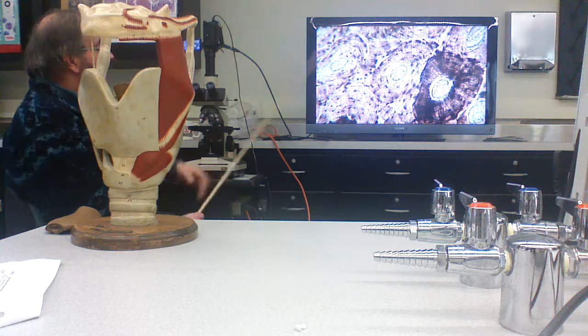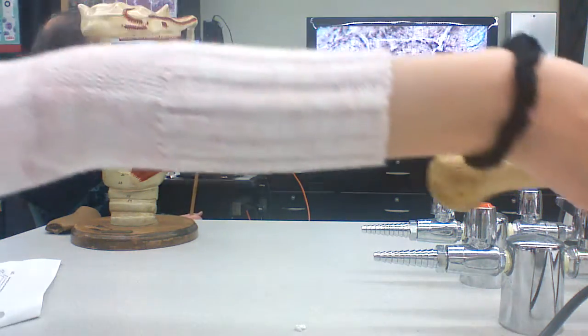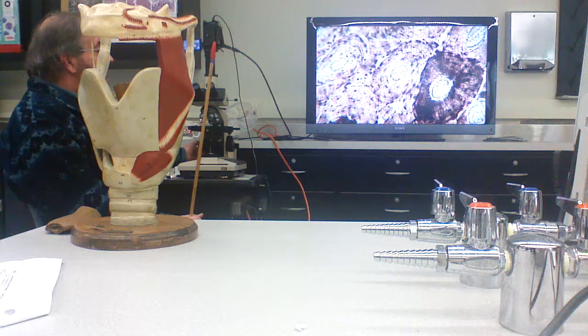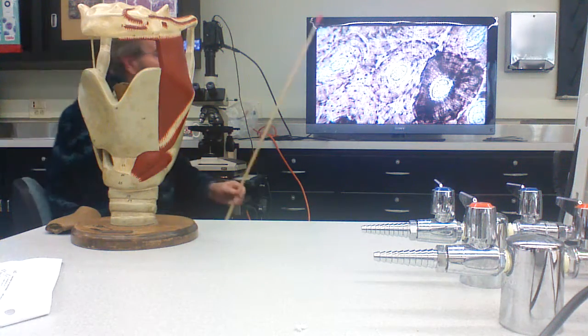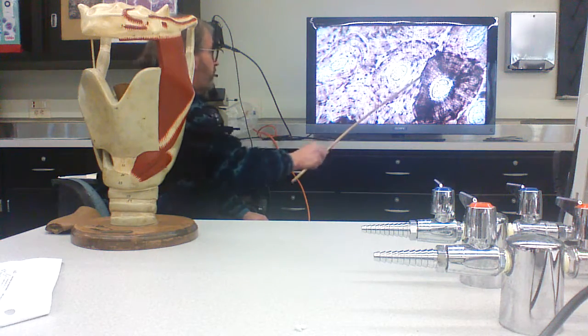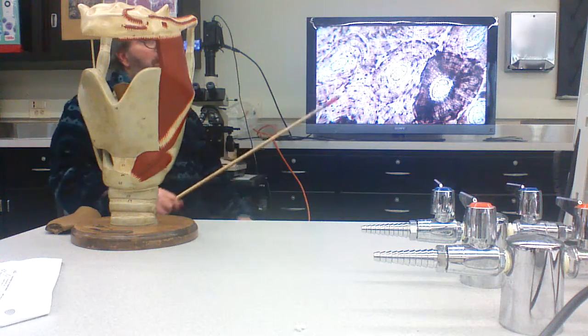A good specimen like these has been polished until it's only about 2 cells thick. And what you see here is all this cylindrical substructure. Why is it?